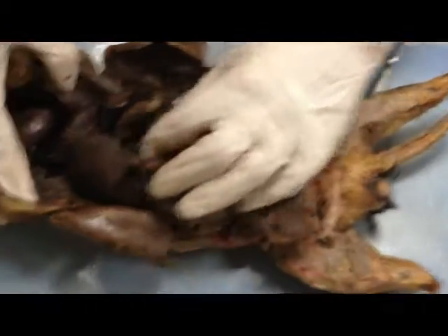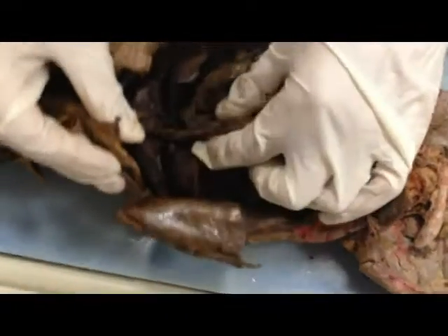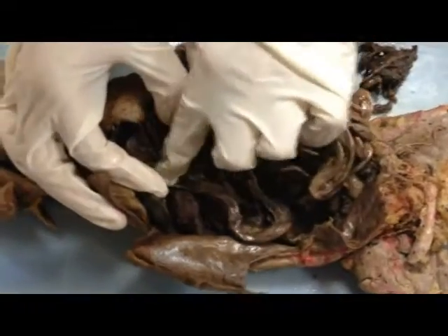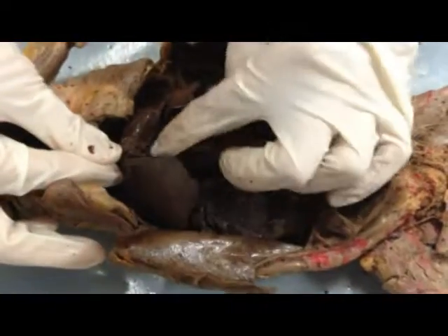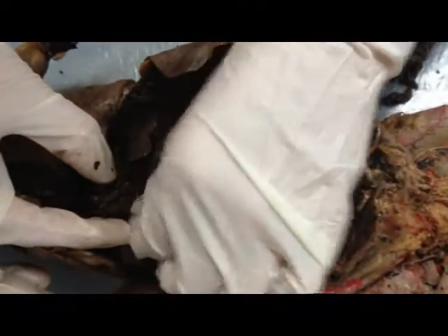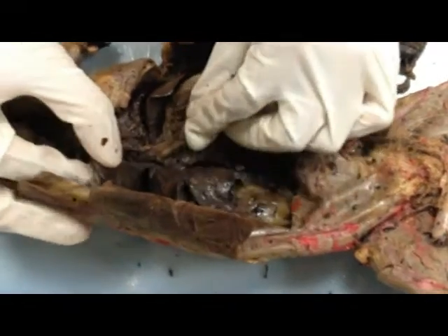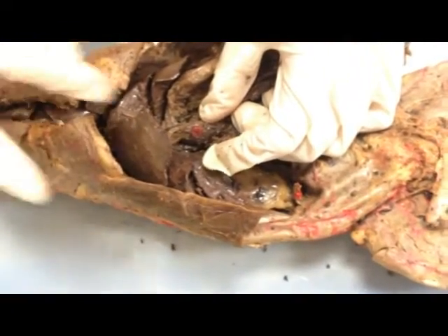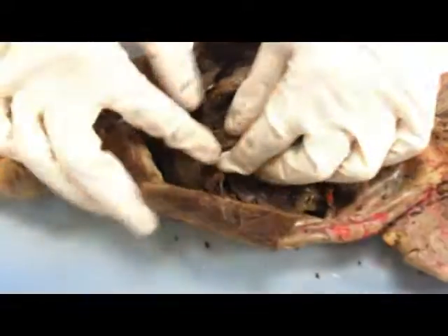You're going to have the liver — so this is the liver. You have the gallbladder, which is sometimes hard to find because sometimes it just looks like a little piece of tissue. It's closer to the front, and it looks more like a droplet, a little cream droplet that comes off of the liver. So this here would be the gallbladder.